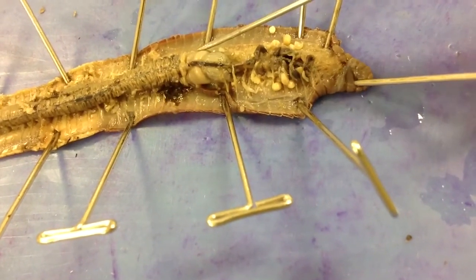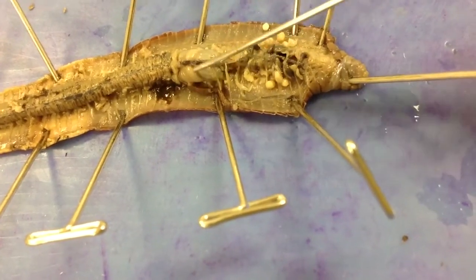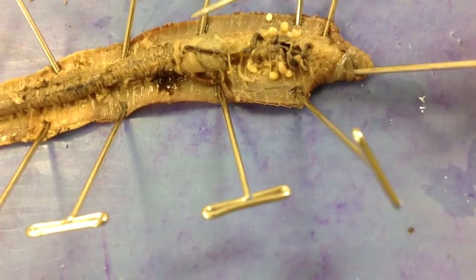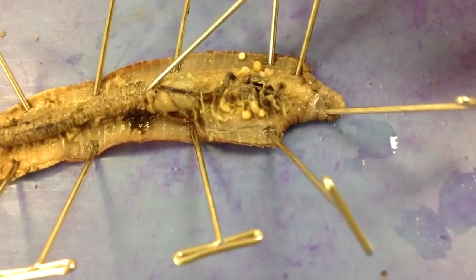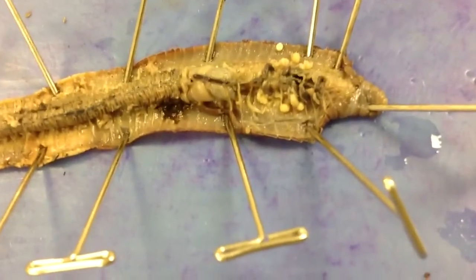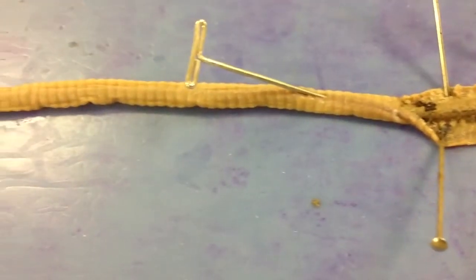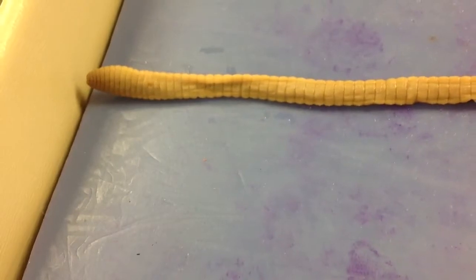It then moves from the crop into this larger white structure called the gizzard. The gizzard is hard — much harder and more muscular. In the gizzard, things are crunched up and digested more, and then they pass into the intestine. Basically the rest of the worm is intestine, from there all the way to the anus.